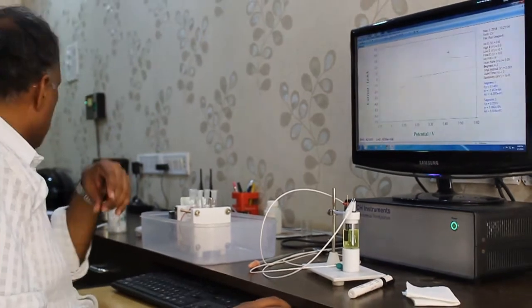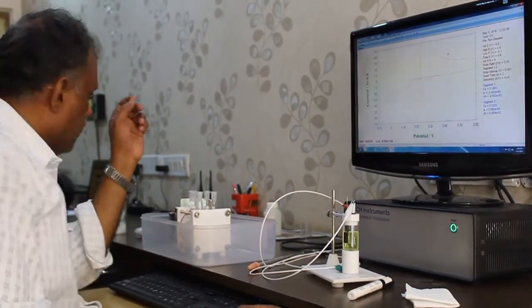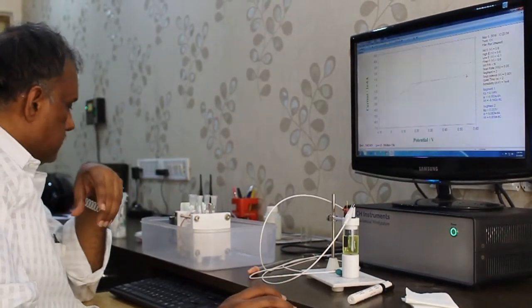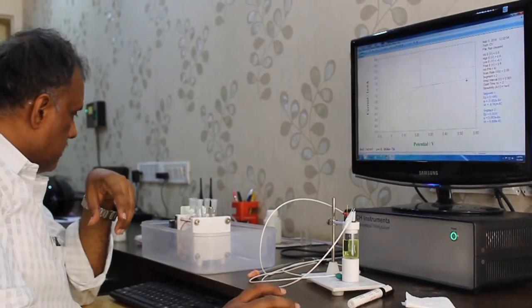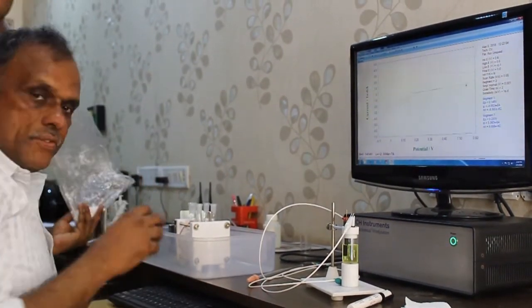Where is the sodium chloride? Can I get some sodium chloride? Raghavji, where is the sodium chloride solution? Yeah, stop for a while.